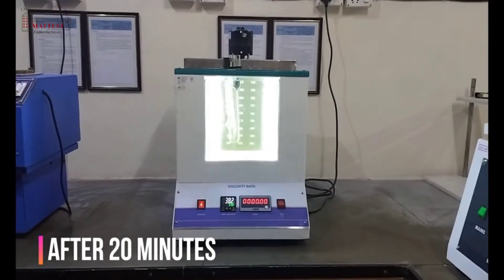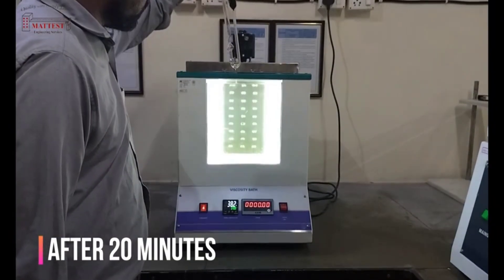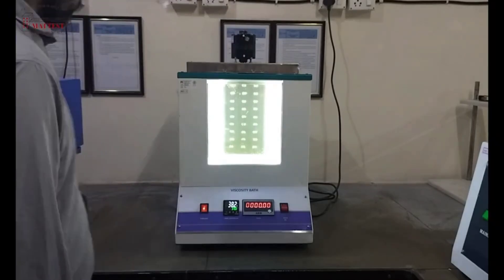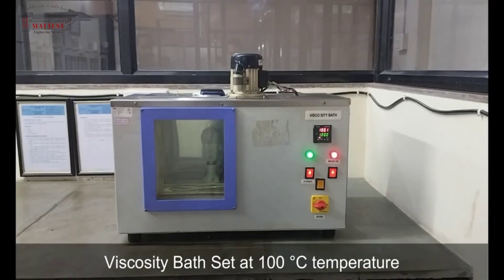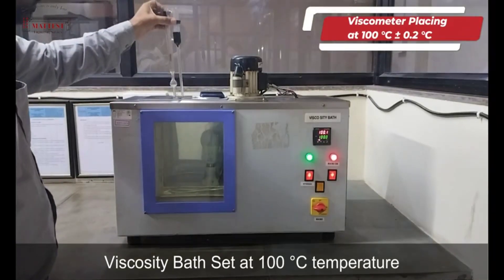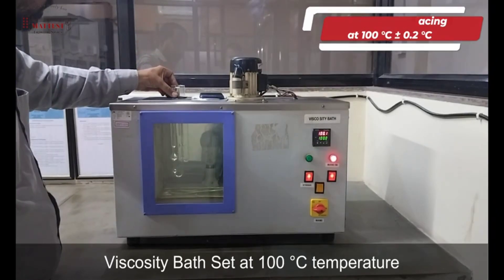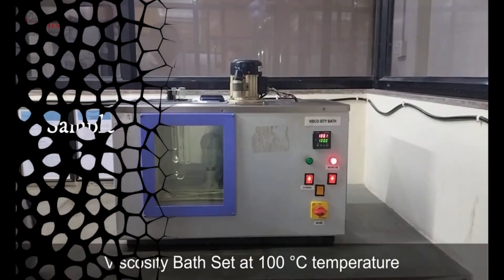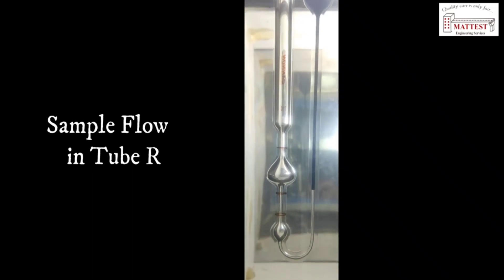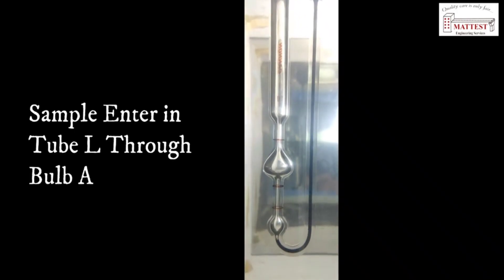After 20 minutes, remove the viscometer tube from the viscosity bath. Set the viscosity bath to 100 degrees Celsius, then place the viscometer tube back into the viscosity bath. During this temperature stage, the sample flows in tube R and the sample enters tube L through bulb A.